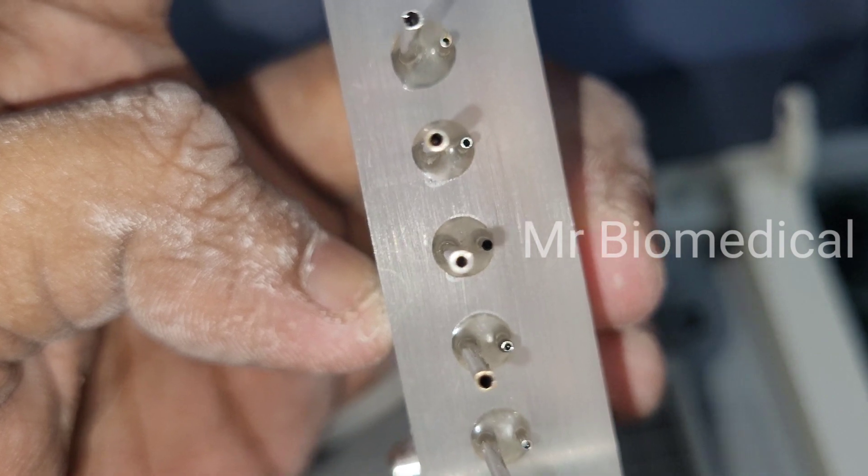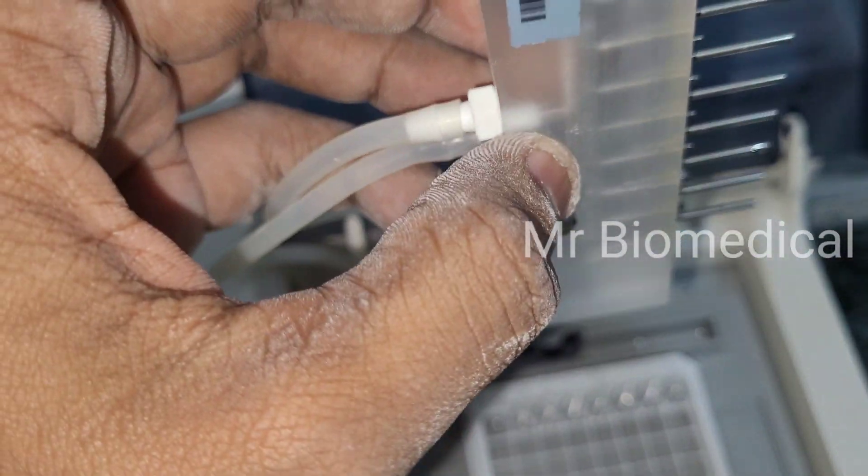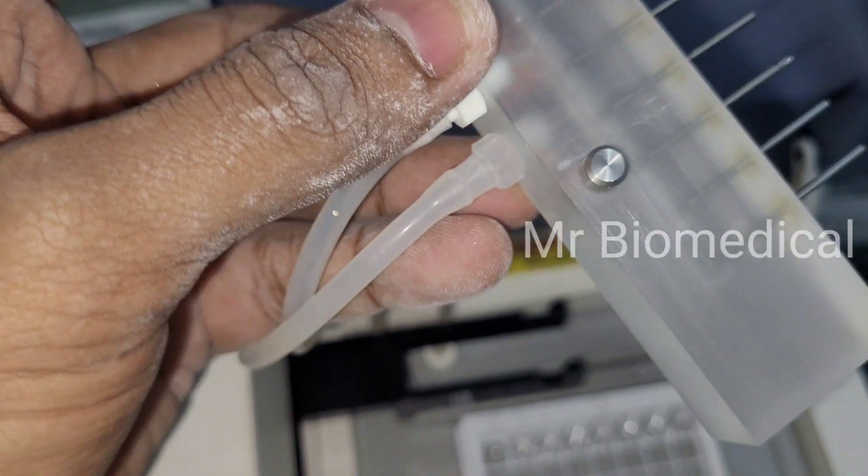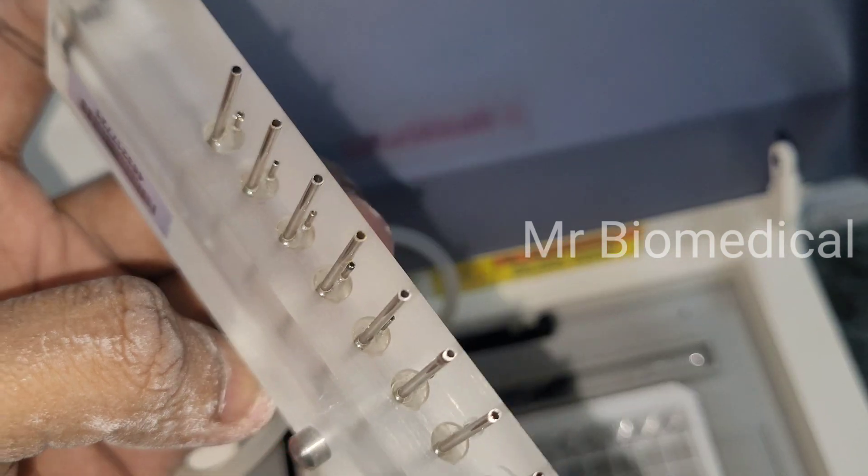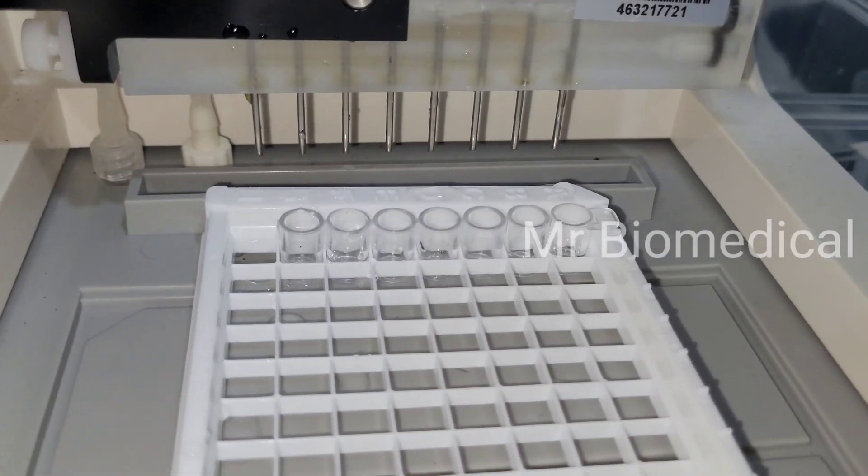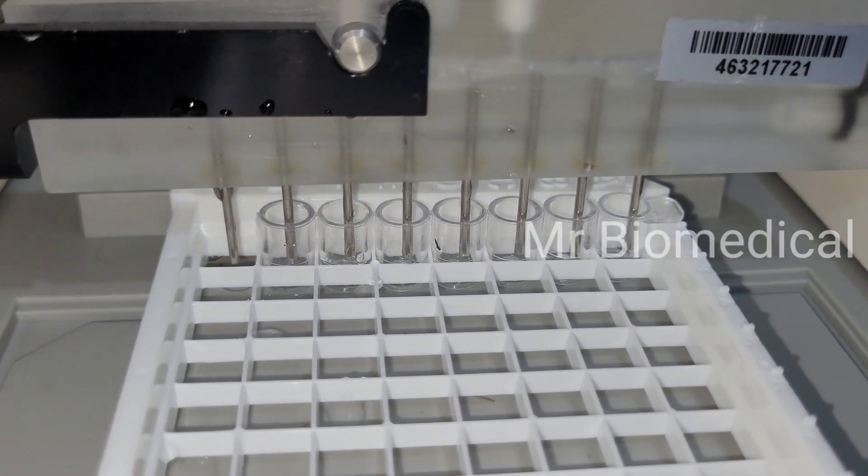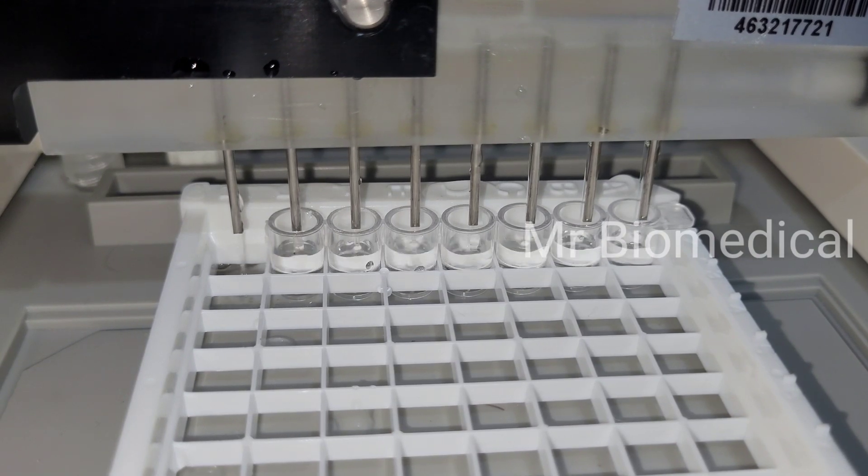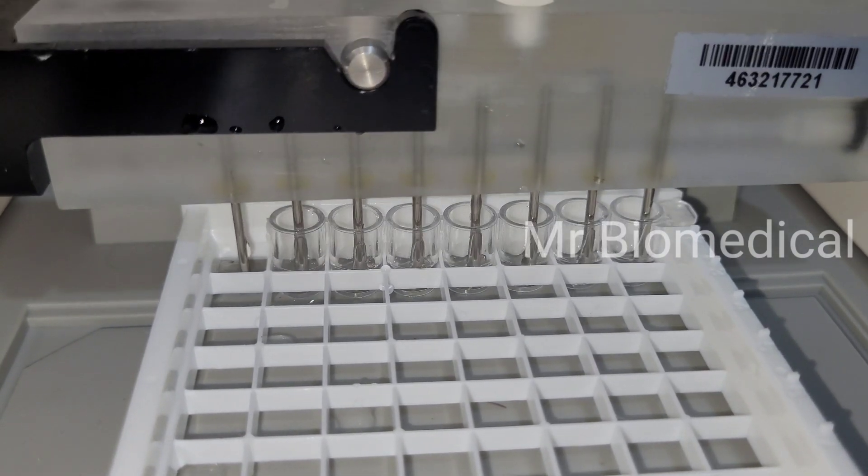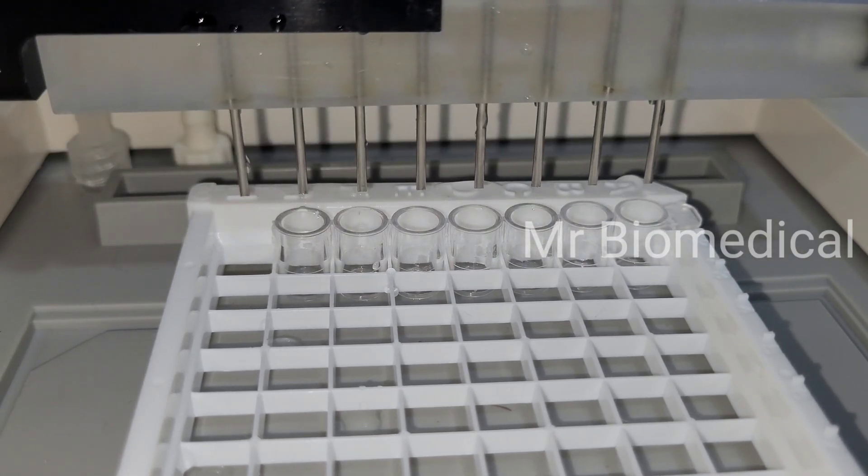Now I removed the needle from the machine and set that one and we will release the block. Let's see. After removing the block, now it will work, that's it. So it will work now.